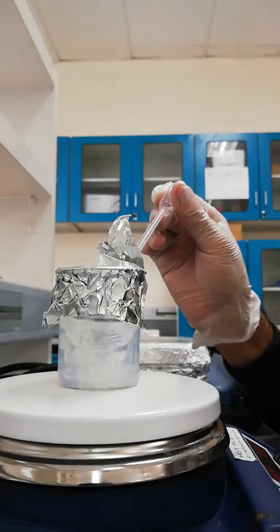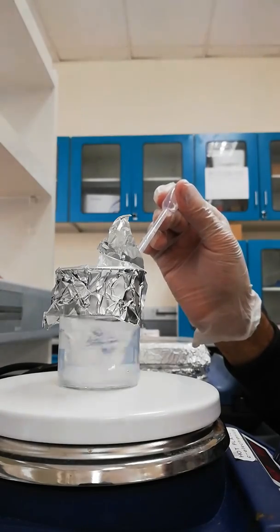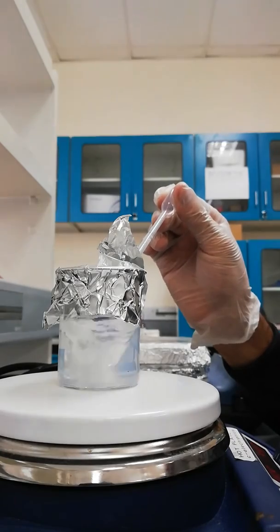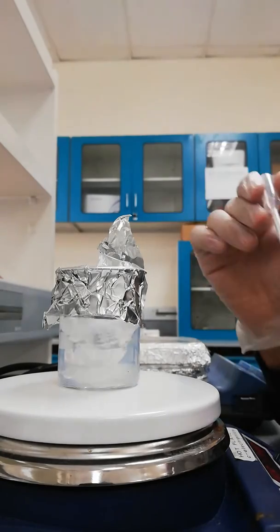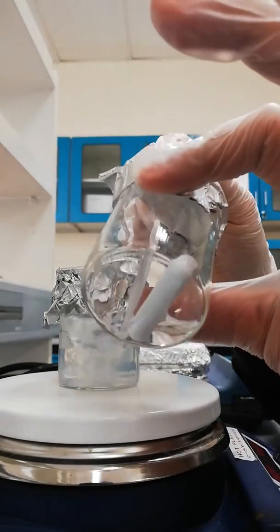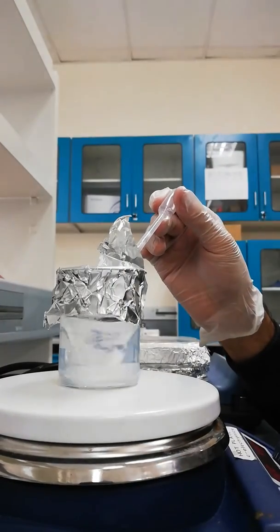I don't know if you can feel it or not but I can feel it - the whitishness is now getting disappeared. This is the solution remained, maybe a few more drops.